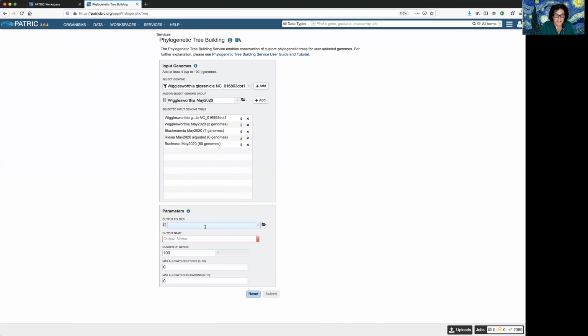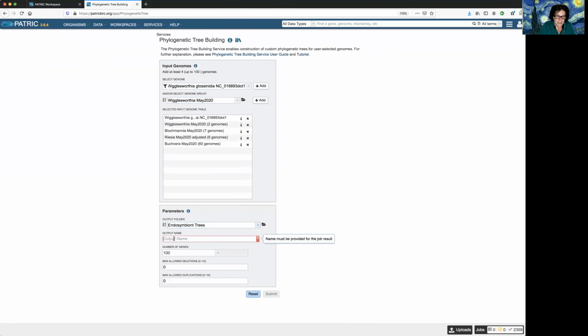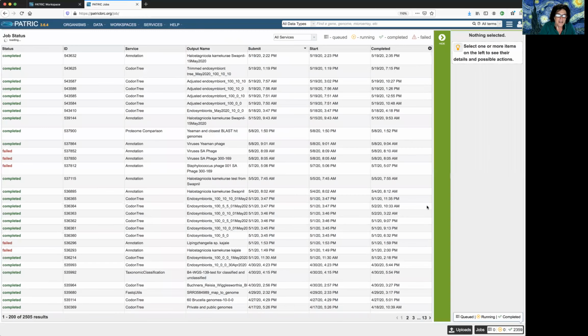And then we just have to find the folder, which was endosymbiont trees. Name, let's see, I'll call it adjusted endosymbiont tree. And then I could launch it. But I'm going to show you one of these that I've already launched. I just wanted to step you through it so you could see how much that improved. So the first one, I'd done it with 10 and I couldn't get 10. I could only get 5. So I'm going to click on the jobs and see the tree that I submitted to look at that.